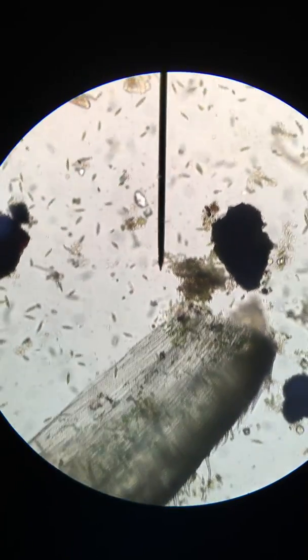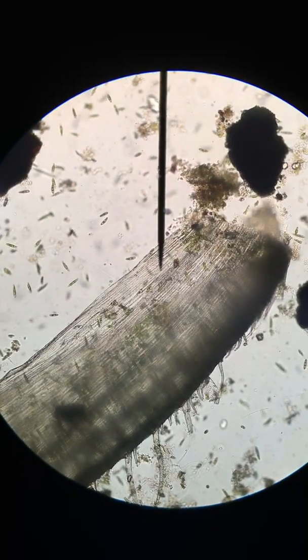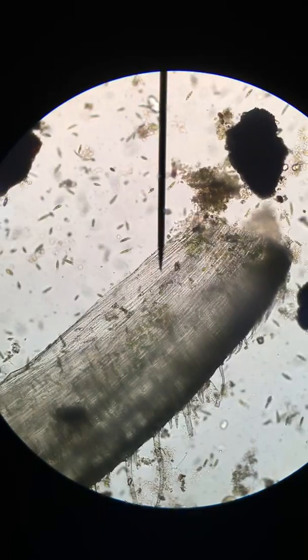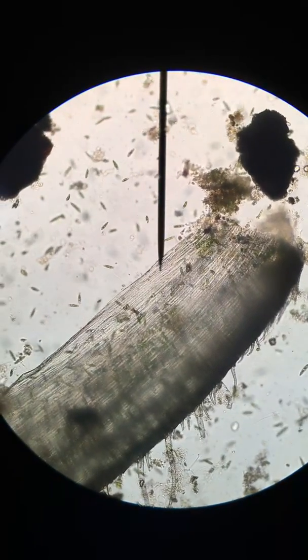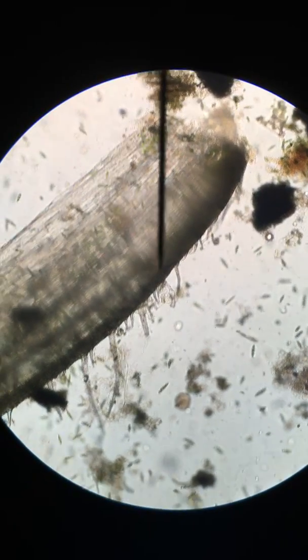This is a big piece of plant tissue. You can tell by those nice regularly sized cells laid out in rows. Probably a tiny little piece of wheat seed. It's interesting to see what likes to cling on to this, isn't it? Look at this, it's like an island.